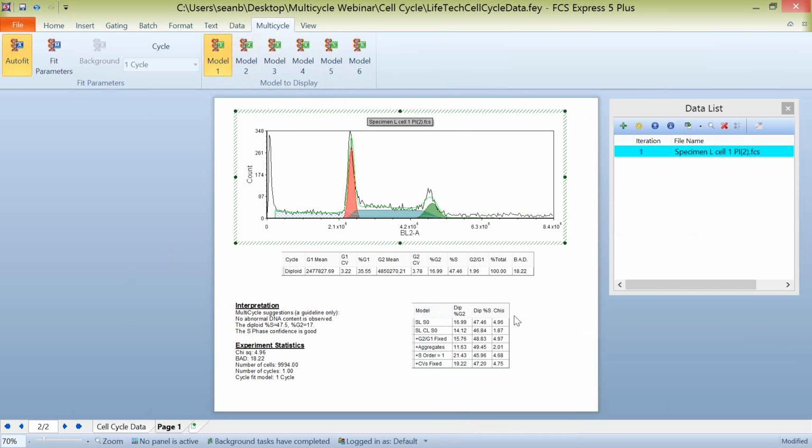With these model summary statistics, one of the values that a lot of people like to use to make a determination whether a model is a good fit or not is the chi-squared value, where generally a lower chi-squared value is going to indicate a better goodness of fit. So when we click on model 2, because it has a 1.87, we can see where G2, G1, and S phases are with that. If we go over here to our aggregates model, which has a value of 2, we can see how that changes. As well, again, with our different models.